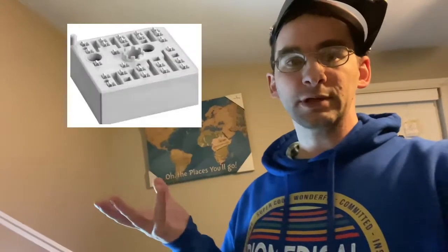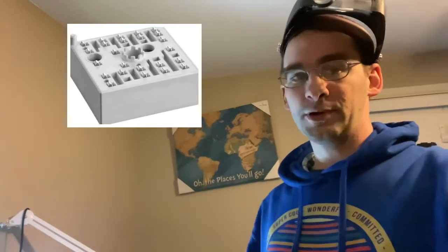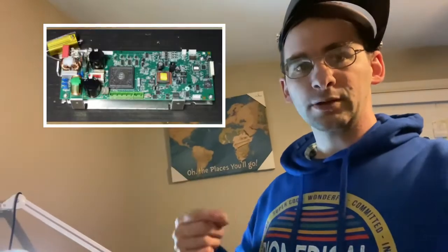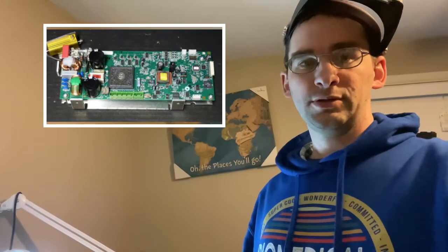This is what the part looks like. I'm going to put it up here. I was able to fix it for the company I work for for 45 bucks. Or you can buy the board, which is like $1,600 or $1,700. But you can just unscrew one screw, get this part, unscrew it, and put it on this board. This is what the board looks like, this is where the part is. A simple fix. It takes longer to take the thing apart than to put the part on itself.